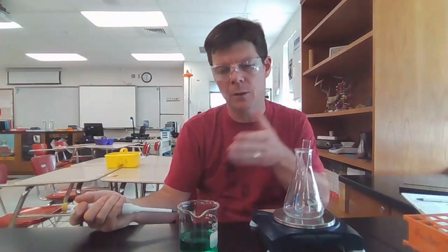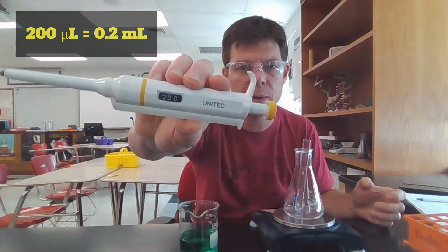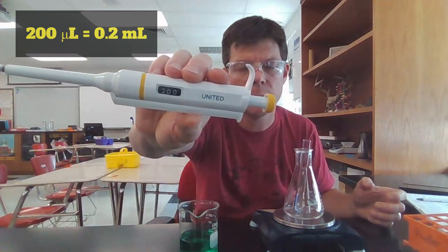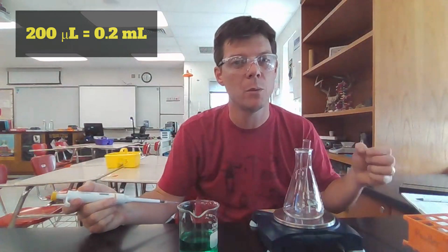I'm going to be transferring water into the test tube. Every time that I transfer, I am transferring a volume of 200 microliters. You can see that this has been set to 200 microliters. That is equivalent to 0.2 milliliters.